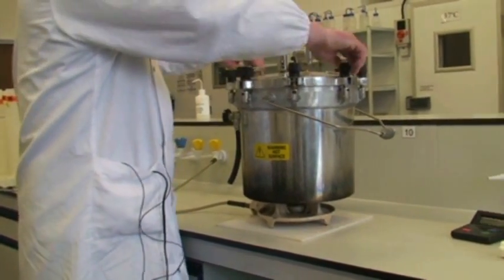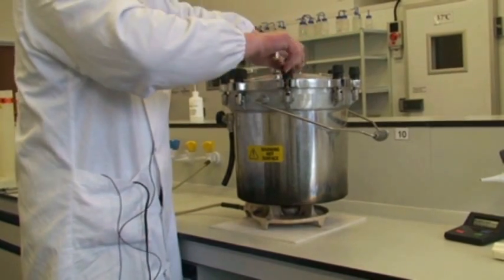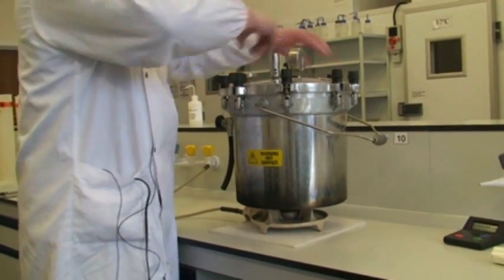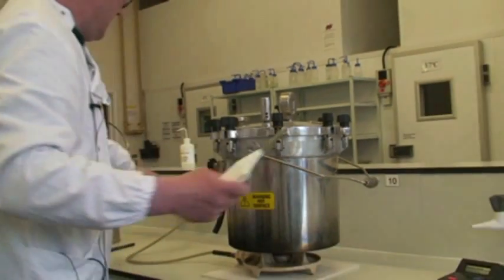When you've done all those, just make sure you've got them all tight and you're ready to light the gas. You can now light the gas.